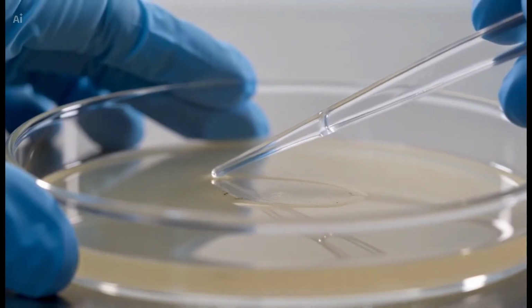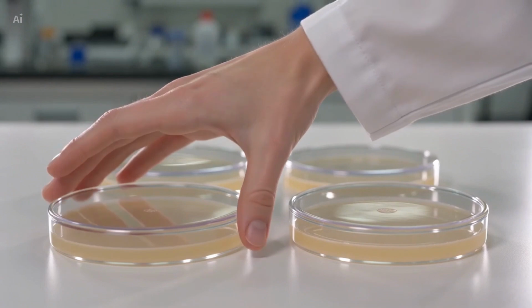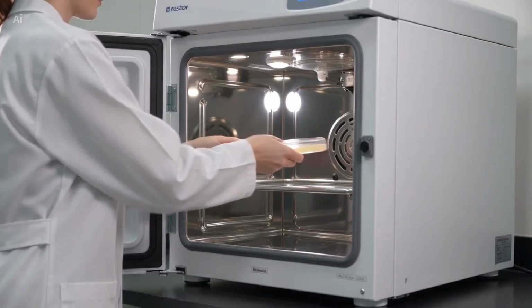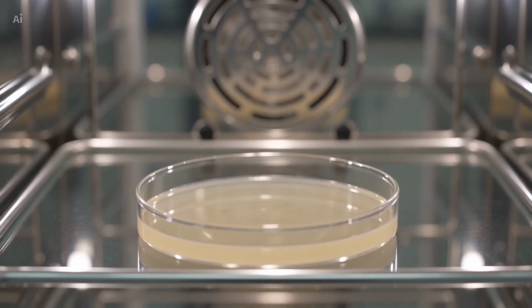Alternative method. If a turntable is not available, the same procedure can be performed by rotating the petri plate manually while gently moving the sterile glass spreader over the agar surface. After incubation, the microbial cells grow only on the surface of the nutrient agar, producing well-isolated colonies. These colonies can be used for identification, viable cell counting, and further microbiological studies.